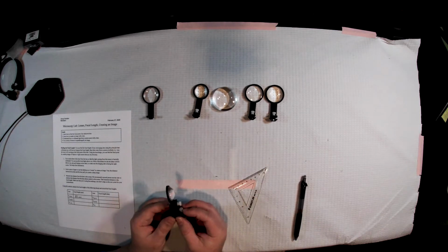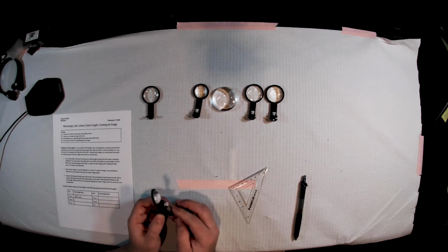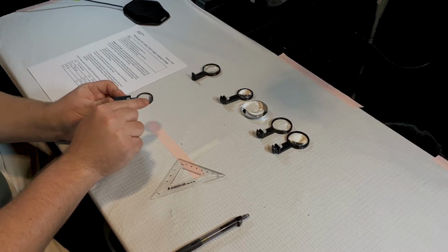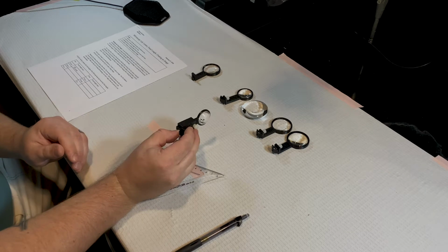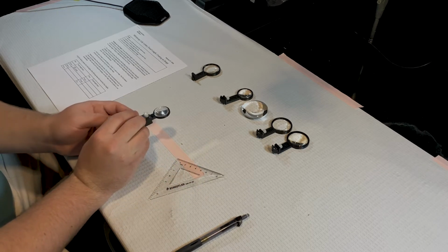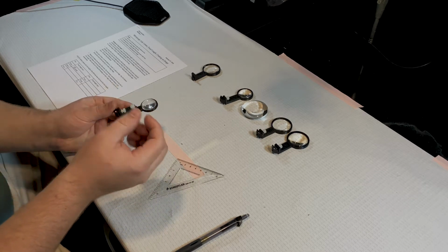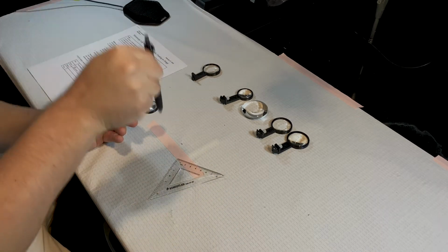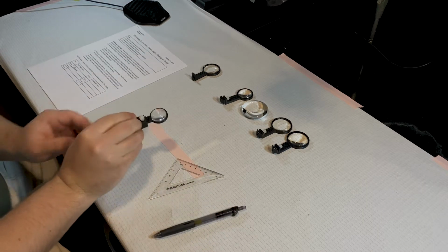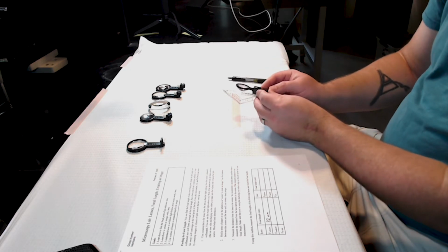All right, so now we're going to take our objective lens. And the other thing that you guys are going to be noticing is that there is typically a flat side and a curved side to most of these lenses. That is because it's easier to focus light when you have 2 surfaces working together to take light that is collimated, essentially coming from one direction all in straight lines, and have it focus down to a point. Now this one has a much shorter focal length.